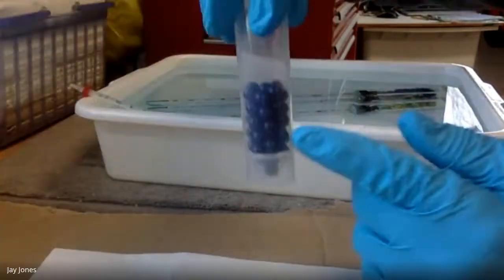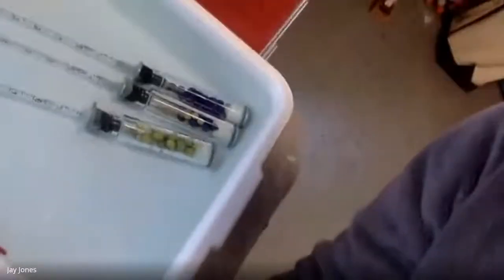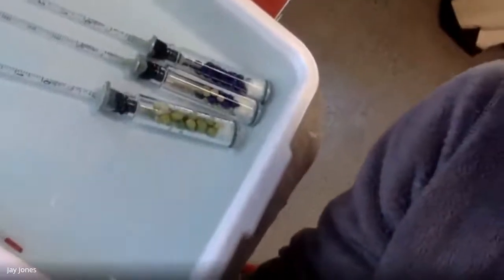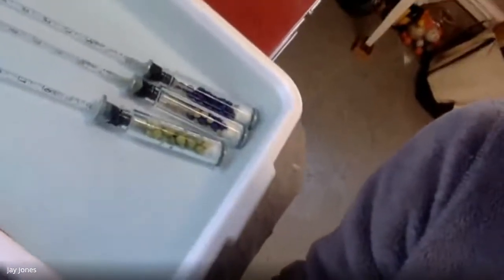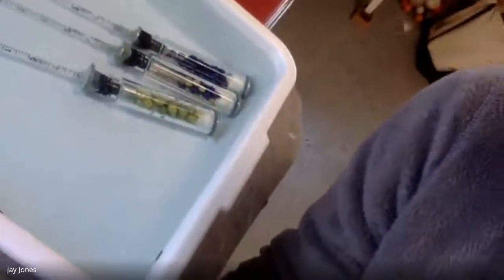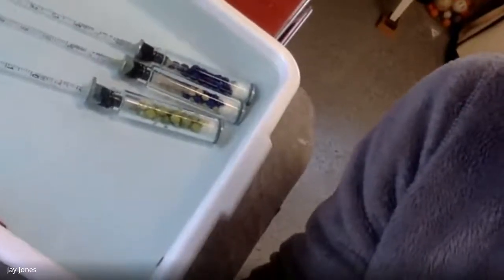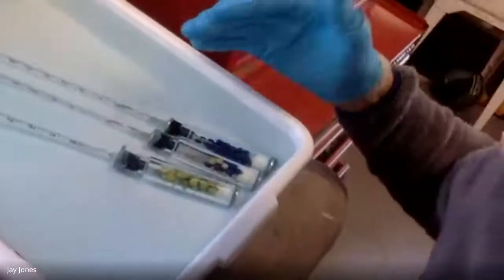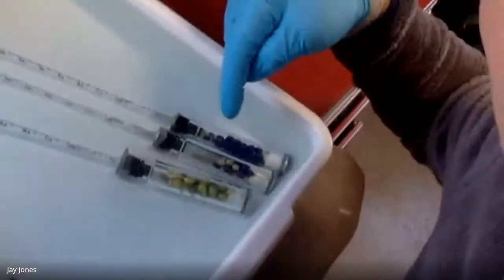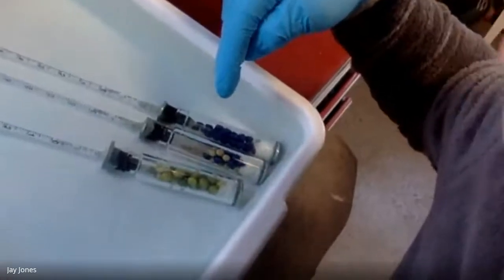But that beads only one, that's the blue one at the end, that's measuring changes in temperature and pressure that we cannot control. We can't account for them. We can't control for them. We can't take out temperature and pressure because we have to do this on the planet Earth, right? And there are changes in our atmosphere, which make micro changes here. So we have to subtract out all the readings from this blue one, the beads only.